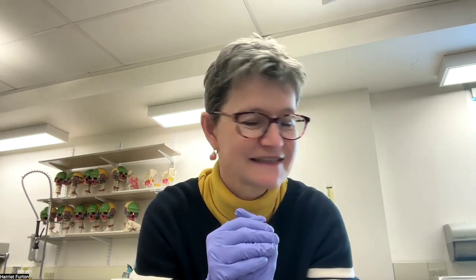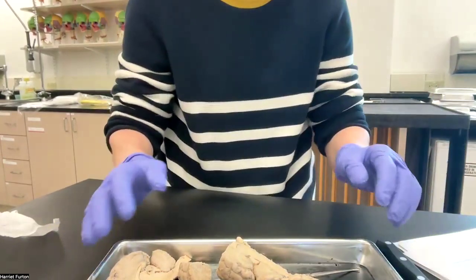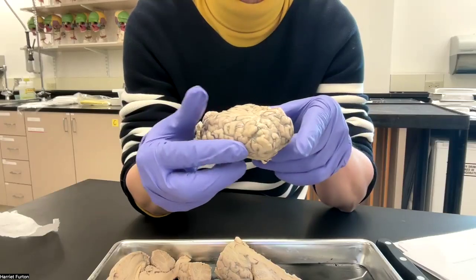Welcome, anatomy students. This is lab 8 about the sheep brain dissection. I will go through the parts, what you have to know and identify on the sheep brain. I turn the camera down a bit so that you will see the brain. I have a couple of them. So the sheep brain looks like this.